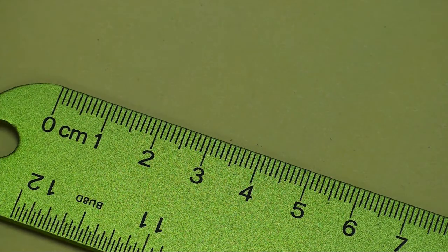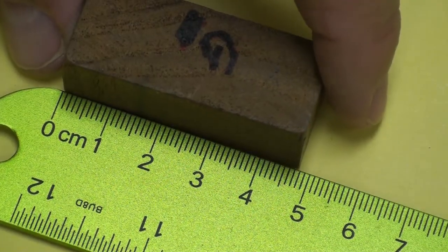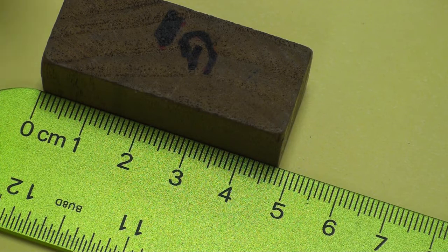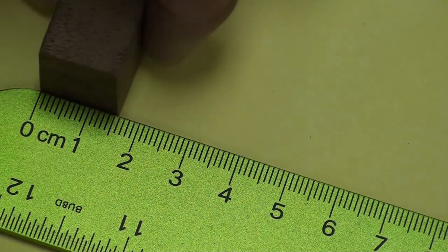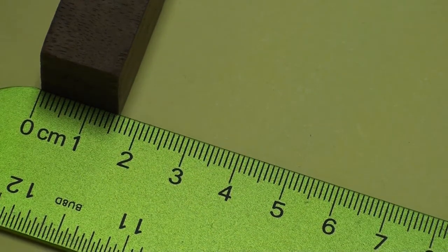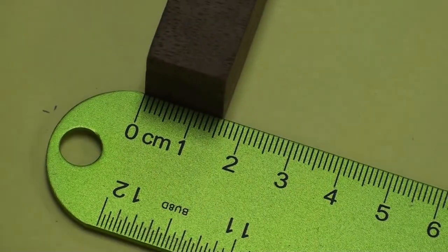Next, let's go to block G. Here's the length of block G. Here's the width of block G. Let me see, I think I was calling this, we'll call this one the width of block G, just for consistency. Once again, just take your best shot. I can't zoom in to make it the perfect shot here.